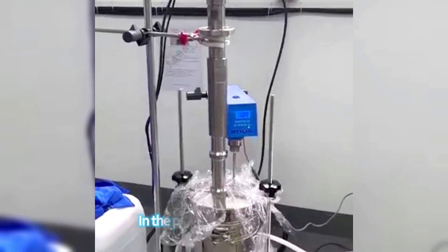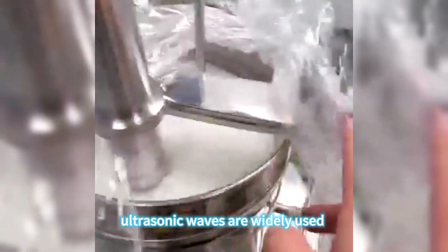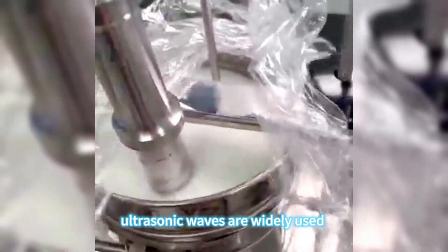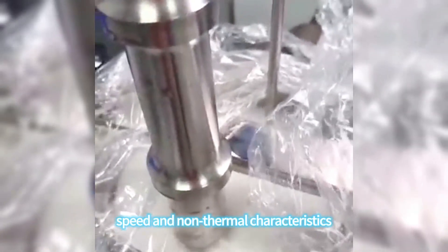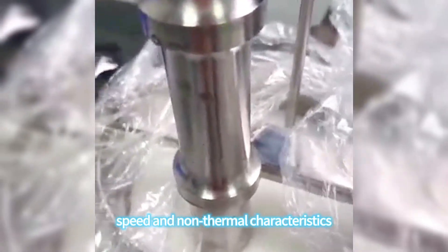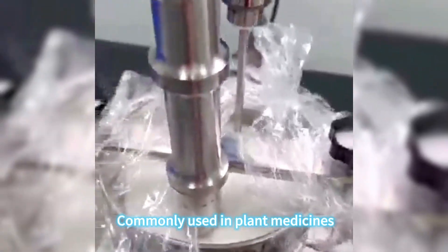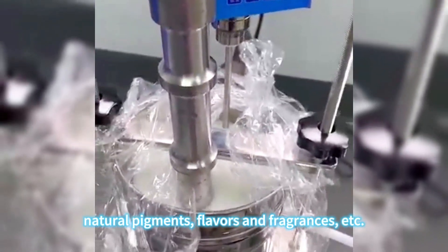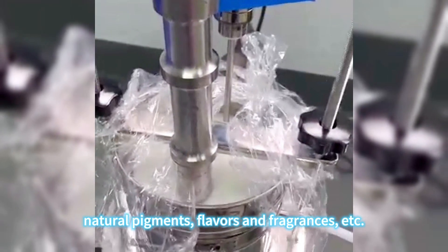In the plant extraction process, ultrasonic waves are widely used because of their high efficiency, speed and non-thermal characteristics, commonly used in plant medicines, natural pigments, flavors and fragrances, etc.